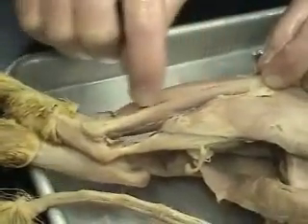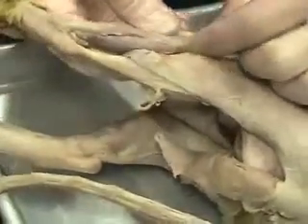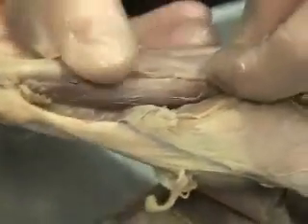Now we'll look at the medial view. On the medial side of the lower leg, here's the tibialis anterior. Next to that is the FDL — the flexor digitorum longus — that flexes the toes; it's on the medial side. On the lateral side, looking at the leg laterally, we see the tibialis anterior on the front, and here on the lateral side, this is the extensor digitorum longus. Just deep to it, the extensor digitorum longus is the fibularis, or peroneus longus — either term — which everts the sole of the foot.